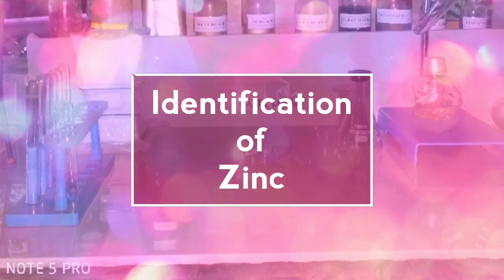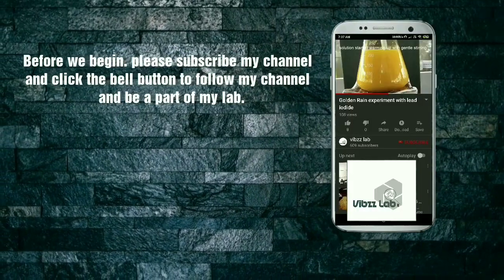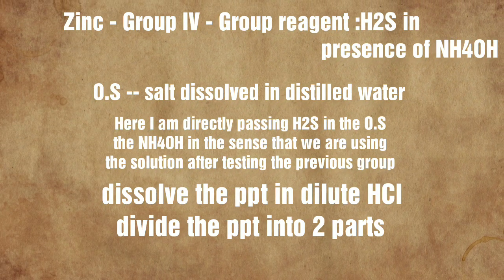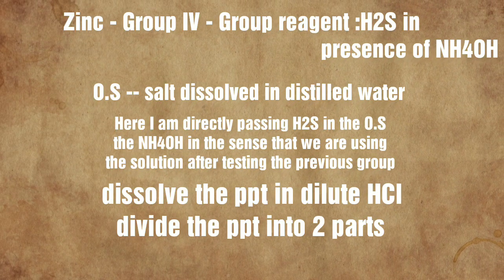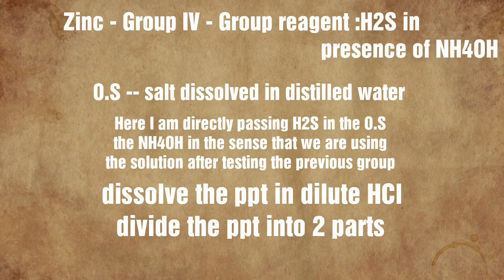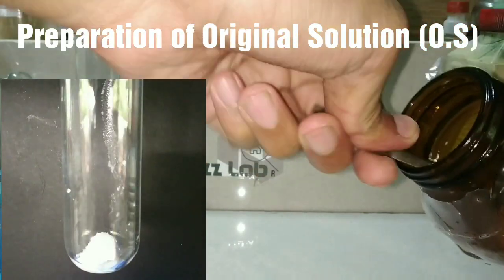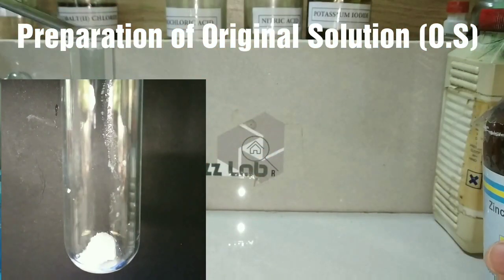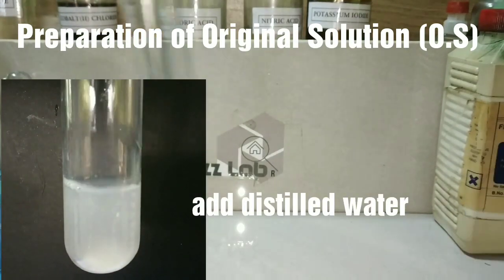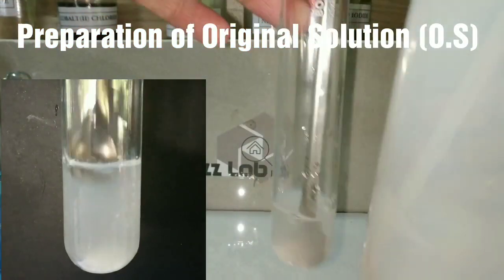Today we would be doing the identification of zinc ions. Zinc belongs to group 4 cation, and the group reagent is hydrogen sulfide in presence of ammonium hydroxide. First of all, we would be preparing the original solution, also called the OS. For preparing the OS, we take the solid salt in a test tube and add distilled water. As the salt of zinc is soluble in water, it easily dissolves, giving a clear solution.